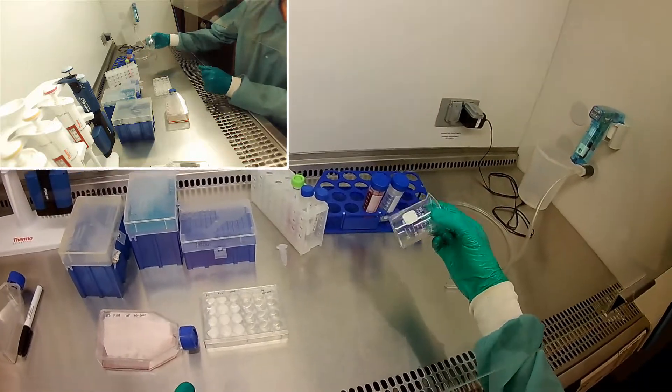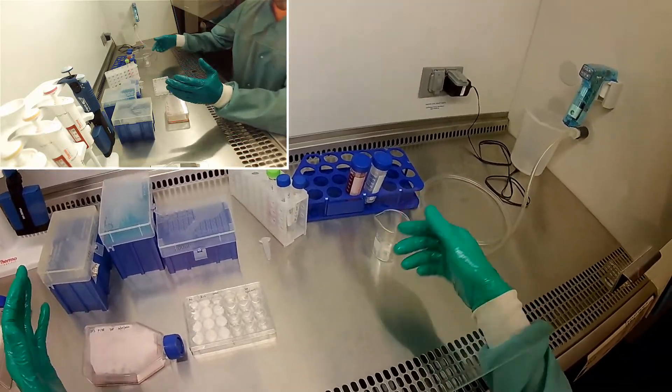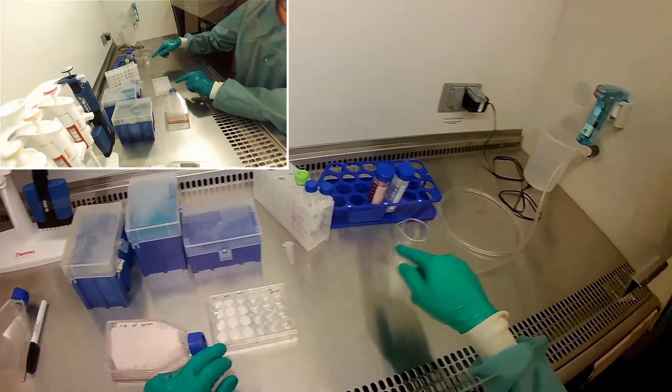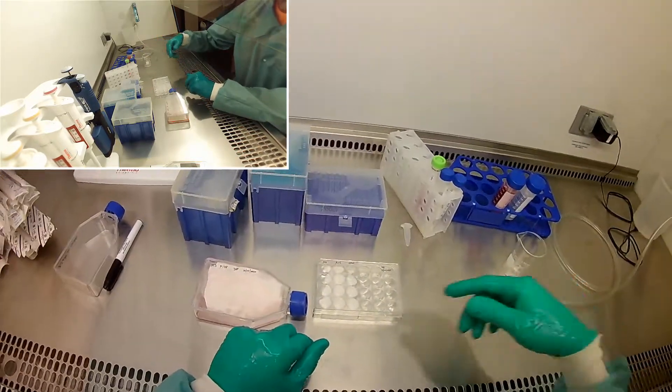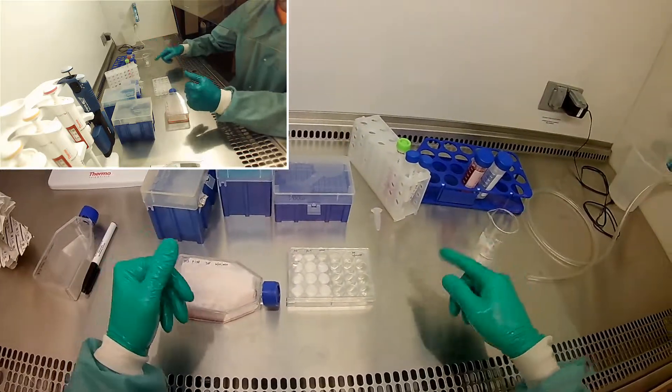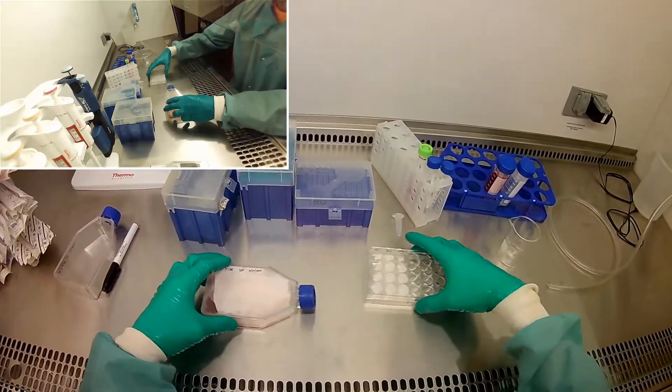Okay, if you're wondering, I have this in here as a liquid waste beaker. When we aspirate the liquid out, we put it in here. The aspirator is just too strong, it would ruin the gel. So we just use the pipettes to do the aspiration, and we have to get rid of the liquid someplace, and that goes in there.